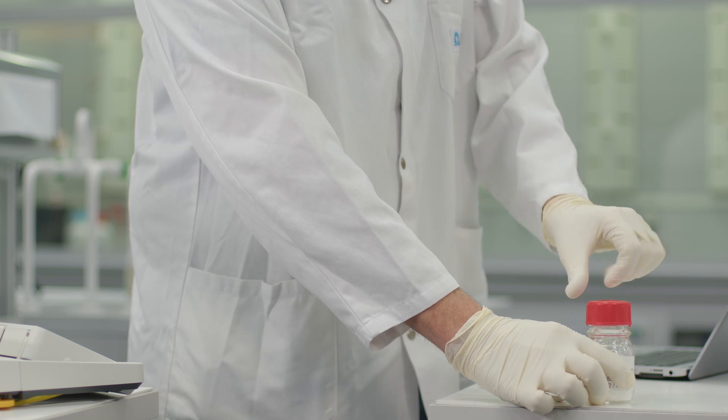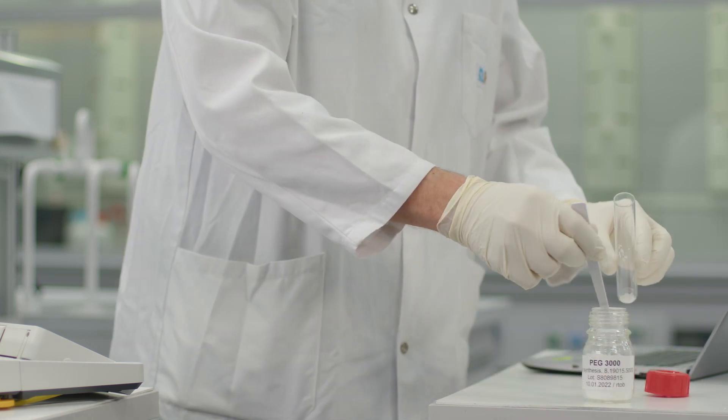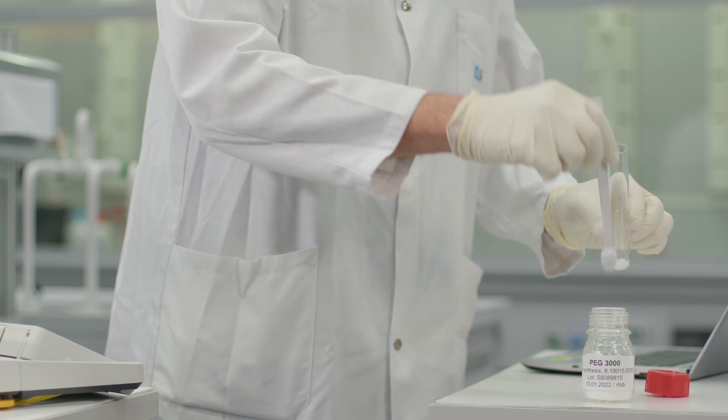As a standard, accurately weigh in 3 grams of PEG. The ratio of PEG to the sample is important.